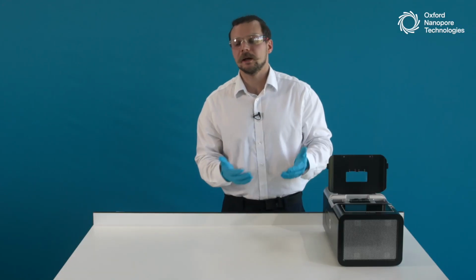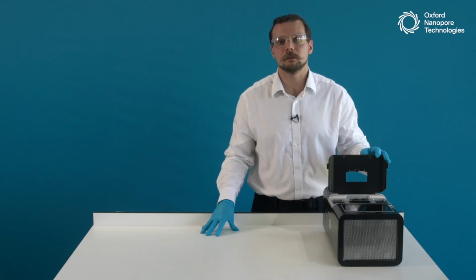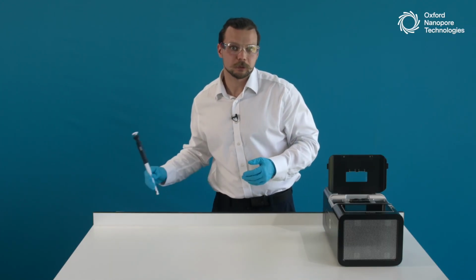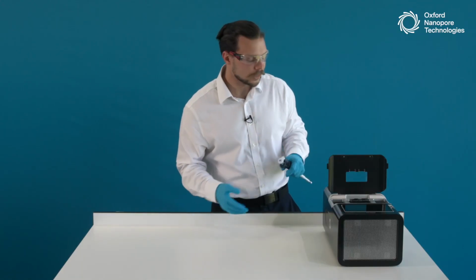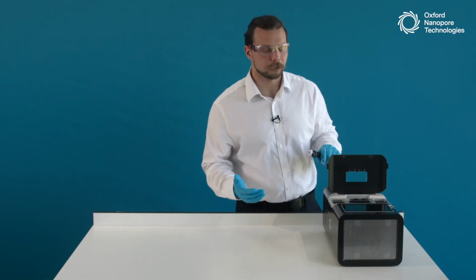This is because air doesn't pass the current really well, and moreover, the air bubbles on the sequencing array can irreversibly damage the nanopores themselves, preventing them from sequencing. So by any means, we always want to make sure there is no air going onto the array.